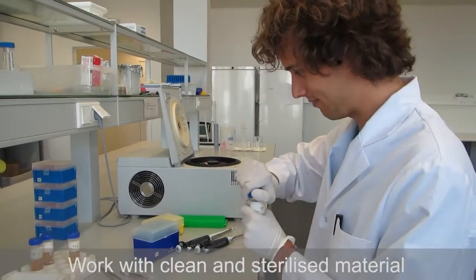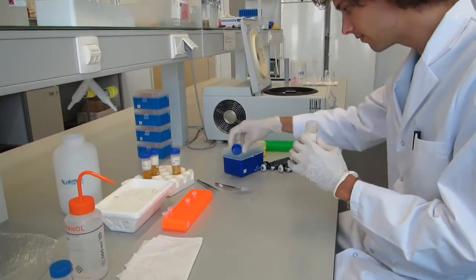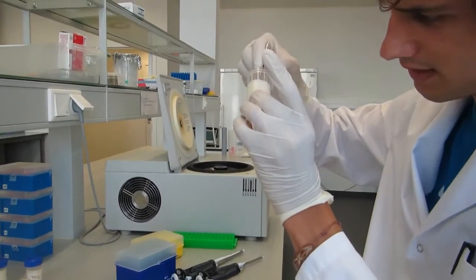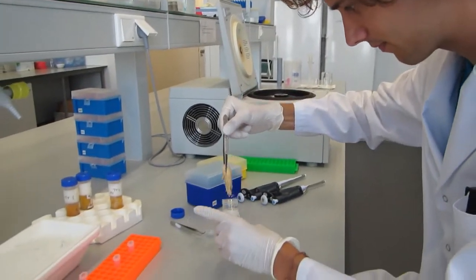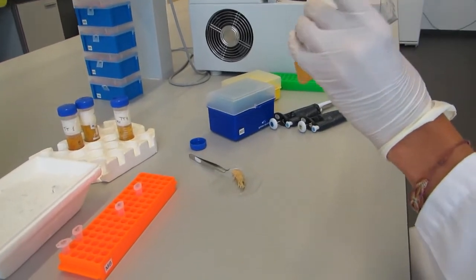We work with clean materials, so it's all sterilized. We take one piece of the shrimp. I will show you the whole shrimp. It's already cut because there has been a sample taken before.